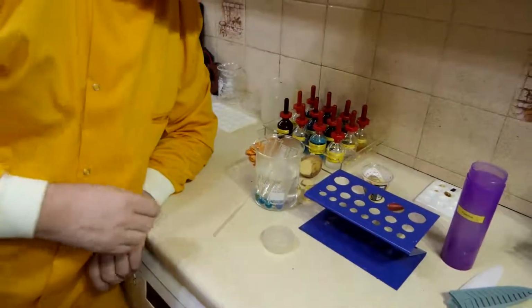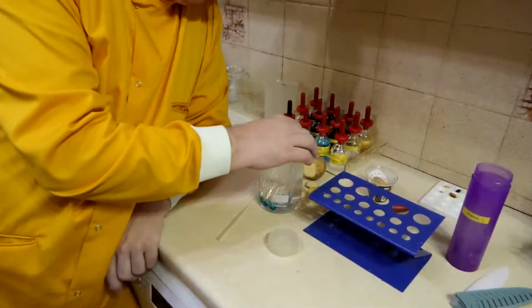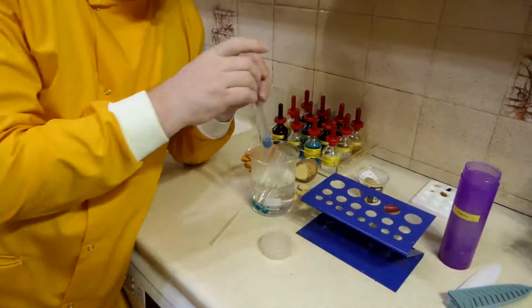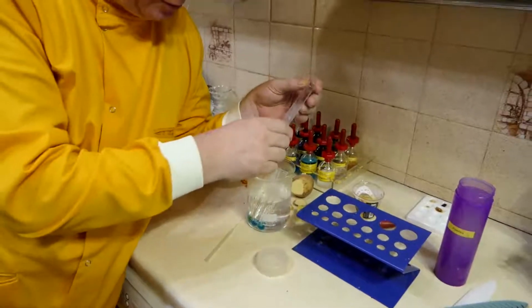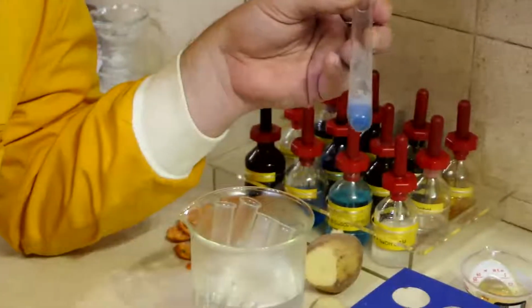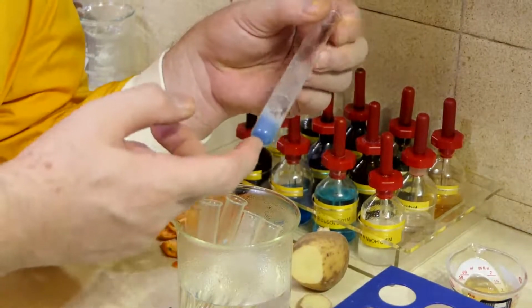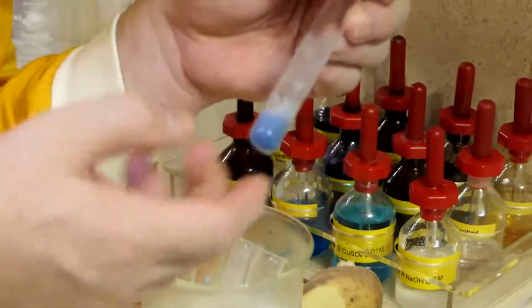One of the reasons we don't often do egg with this is the egg's cooking nicely in there. It's not gone a nice colour here, has it? It's certainly still blue. It's sort of purplish, really.